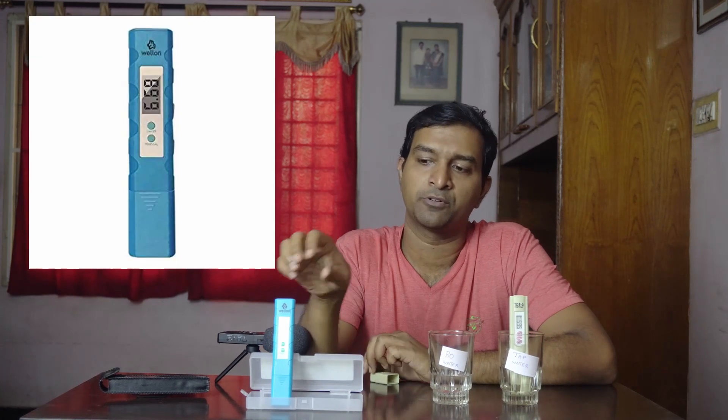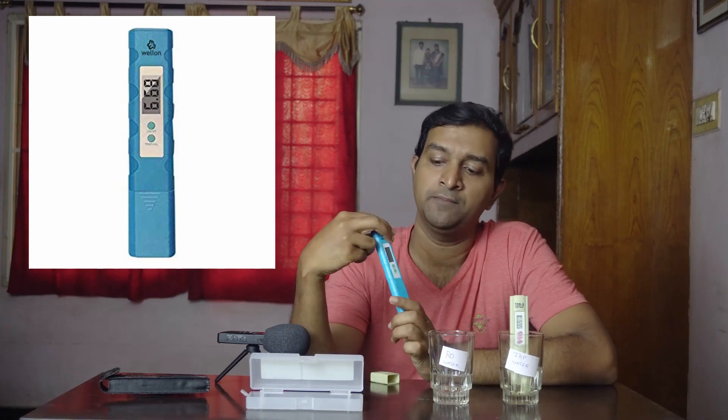So if we wait 1 to 2 minutes, we will get the actual value. We will calibrate the reading.